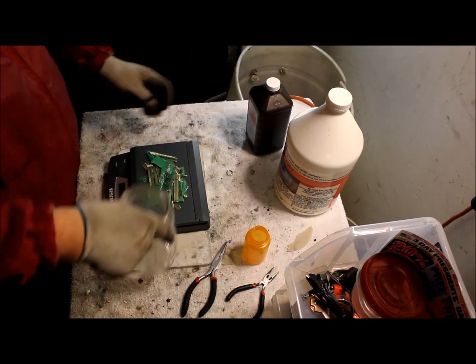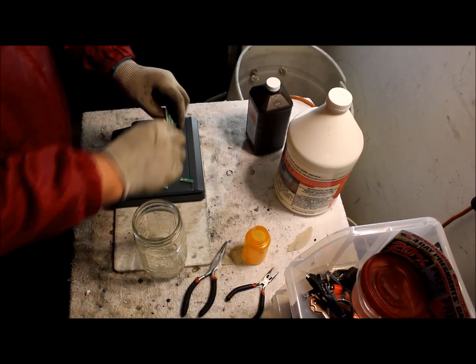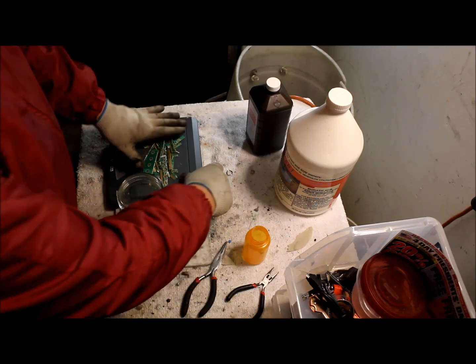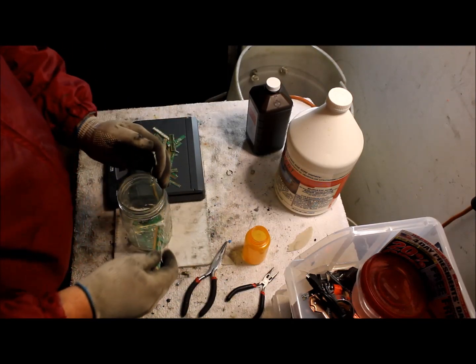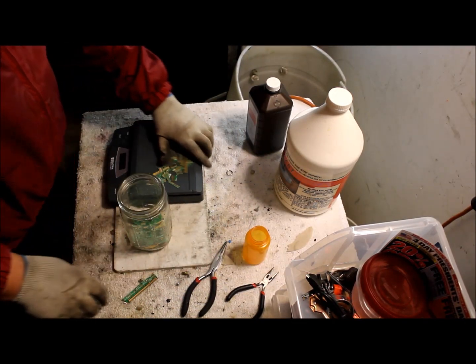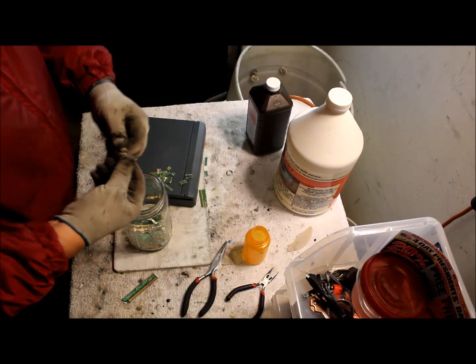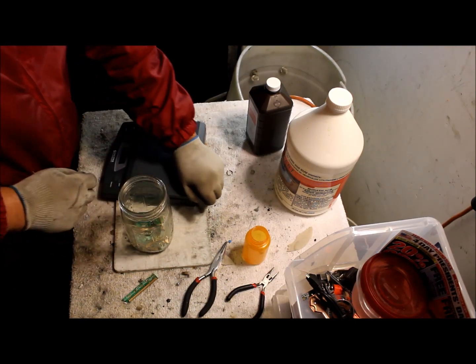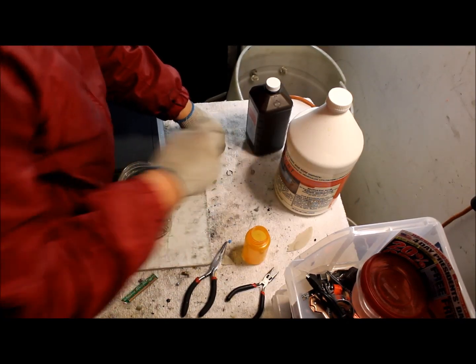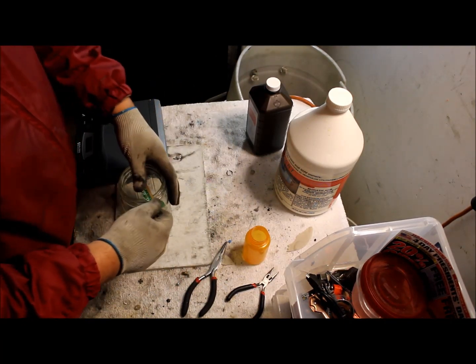We'll just get the jar and throw them in there. You want them to be all flat, laying flat, so they can get the maximum exposure to the acid peroxide solution. Just break the pieces if needed.